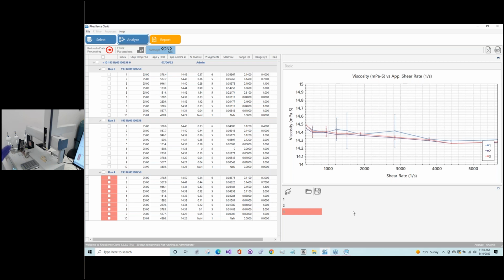And so what you want to do is look at the viscosity as a function of shear rate. So not only are you looking to make sure that the overall value is appropriate and within the 2% specification, but you want to make sure that the behavior is indeed Newtonian, because this could help you troubleshoot. Sometimes if you do have leaking behind the piston in the test syringe, then you can have what appears to be non-Newtonian behavior. And there are some other things it could lead you to troubleshoot as well. But you want to look for that overall value within the 2%, and then for something that is truly Newtonian as a function of shear rate.